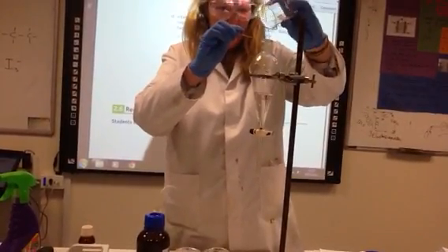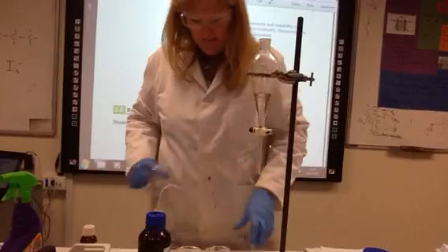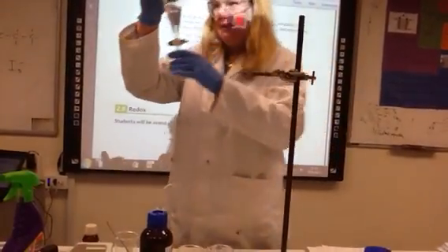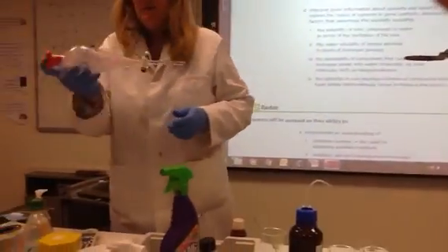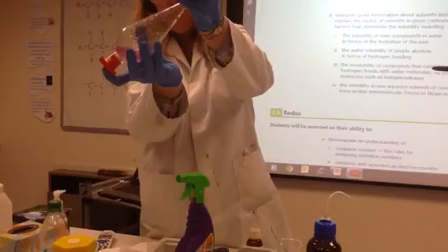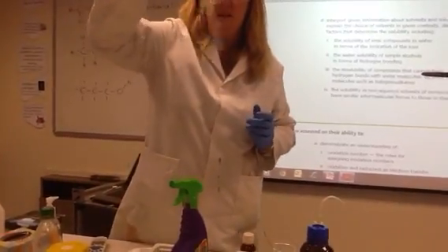And we're going to give it a shake, because obviously if we want a reaction to happen between those two layers, we want something to happen, we're going to have to mix the layers together. So we do that, moving around. And what's happening? Where's the iodine going?